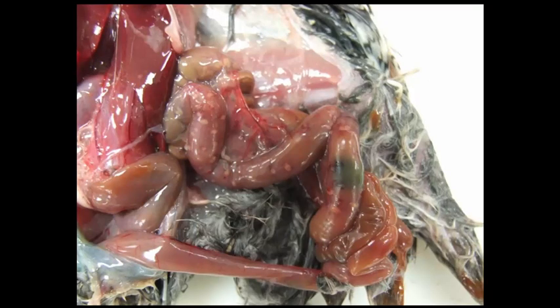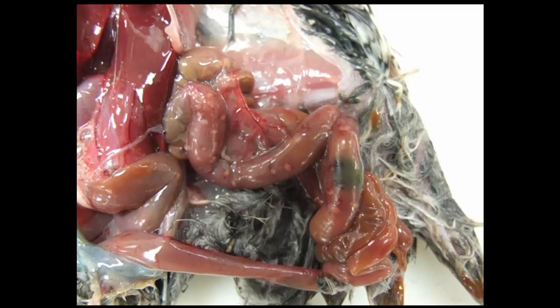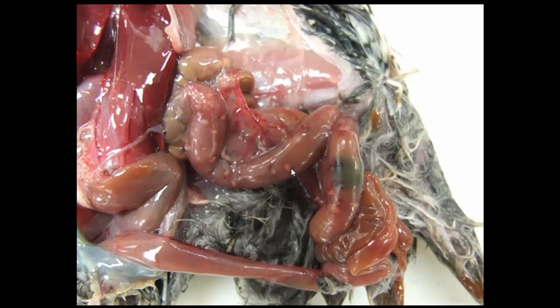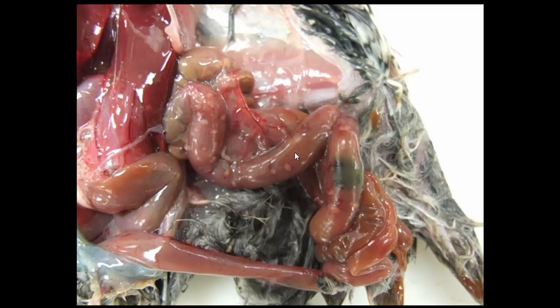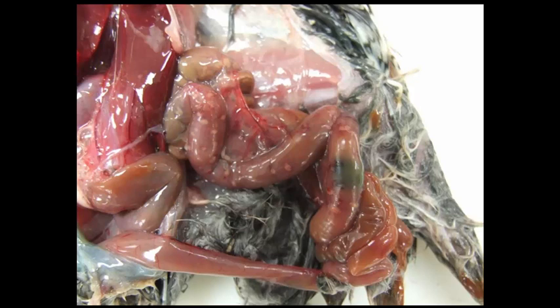Slide number one is tissue from a quail. Can you give me a morphologic diagnosis and a cause? The morphologic diagnosis for this particular lesion is a multifocal coalescing ulcerative enteritis. The cause is Clostridium colinum, and the name of the disease has been referred to as quail disease or ulcerative enteritis.